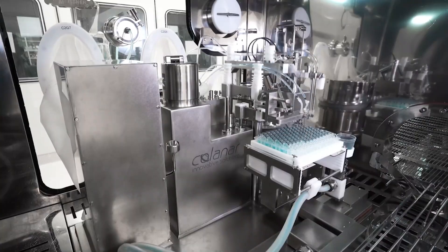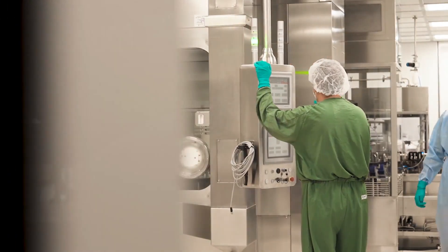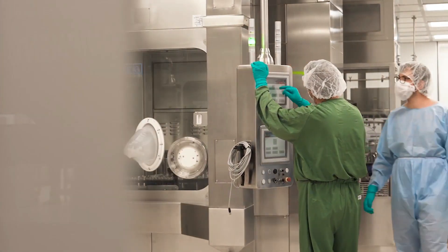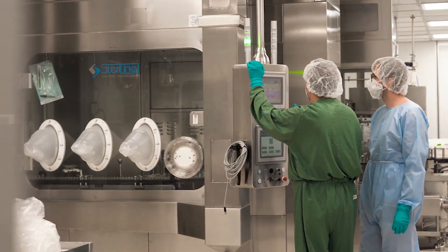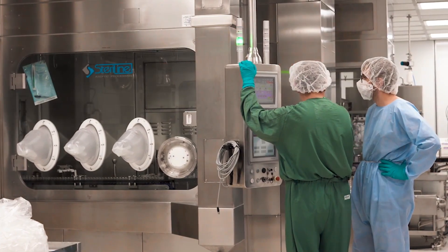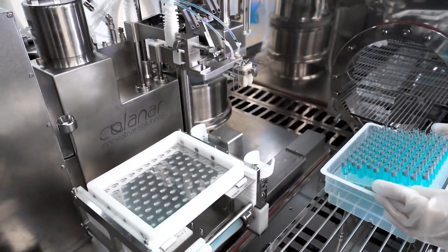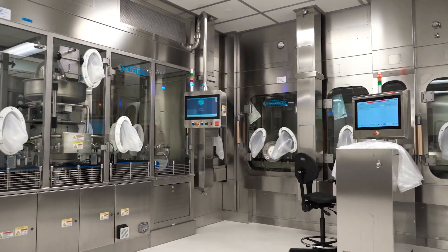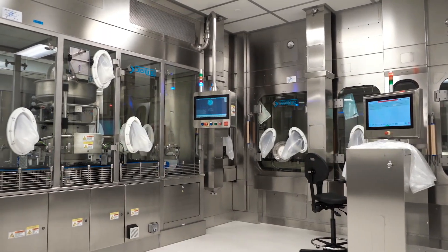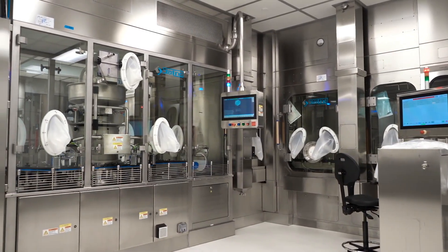Filling isolators are advanced systems used in pharmaceutical manufacturing to maintain a sterile environment for the aseptic filling of products, such as vials or syringes. These isolators provide physical separation between the filling process and the surrounding environment, typically achieved through a controlled, closed-loop system of sterilized air or gas, often HEPA-filtered gloves, and sealed chambers.